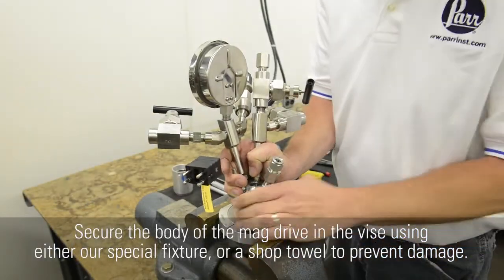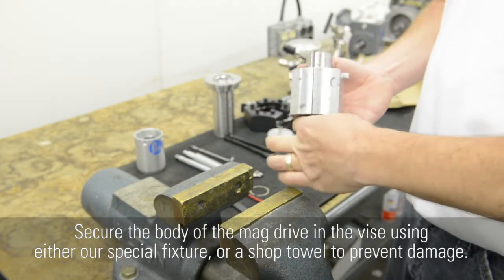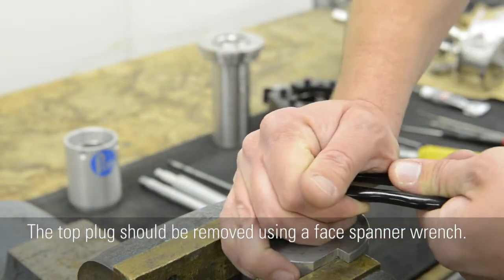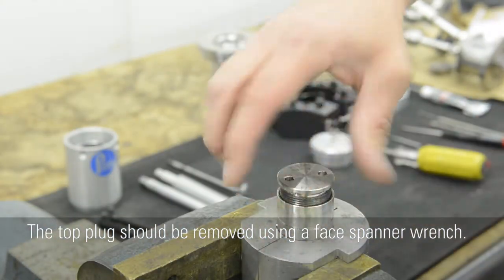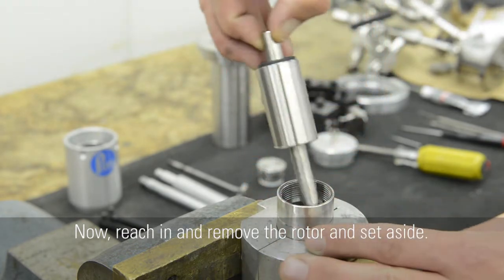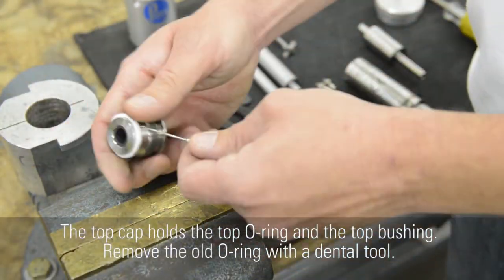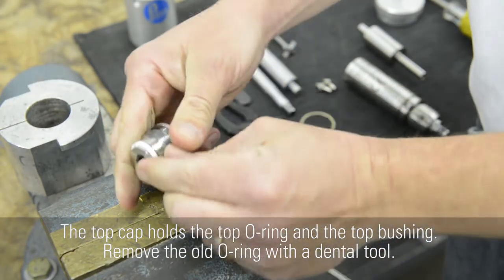Secure the body of the mag drive in the vise using either our special fixture or a shop towel to prevent damage. The top plug should be removed using a face spanner wrench. Now, reach in and remove the rotor and set aside. Remove the housing from the vise and tip it to remove the thrust washer. The top cap holds the top O-ring and the top bushing. Remove the old O-ring with a dental tool.